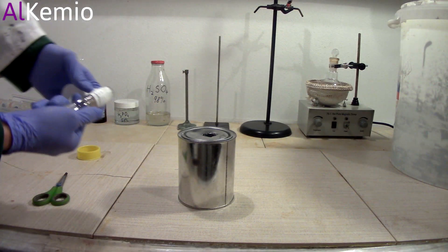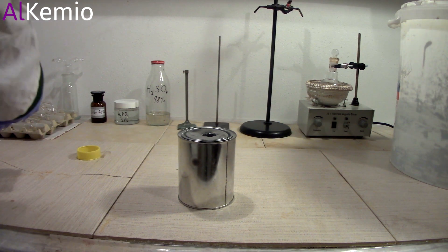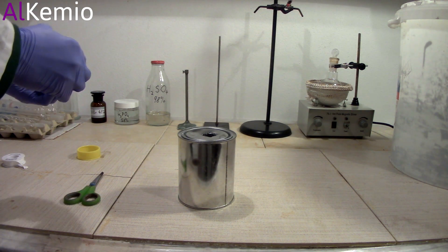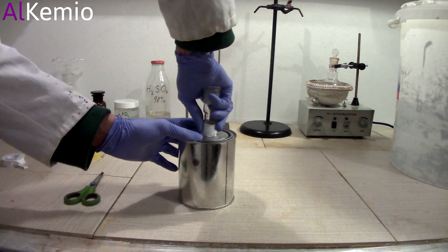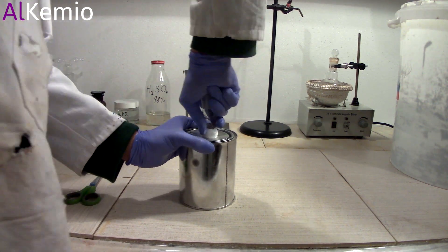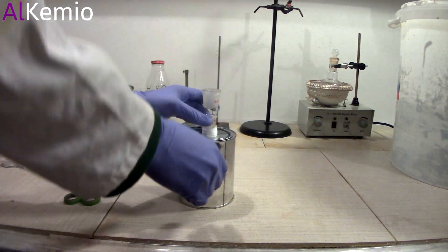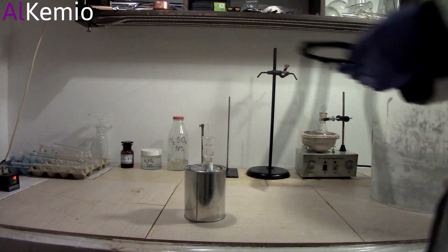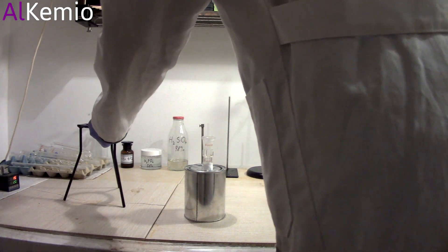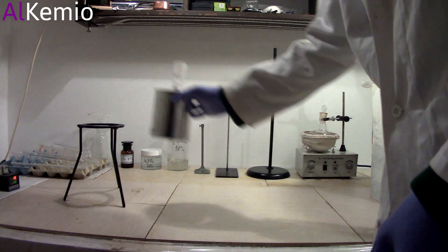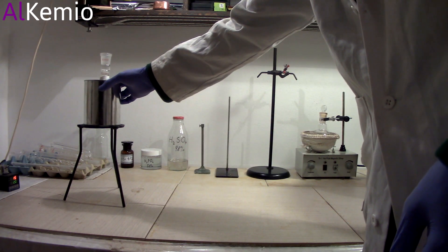Here I was trying to seal the adapter with teflon tape. Then I began assembling apparatus. Anything that could leak would also have to be sealed with teflon tape.